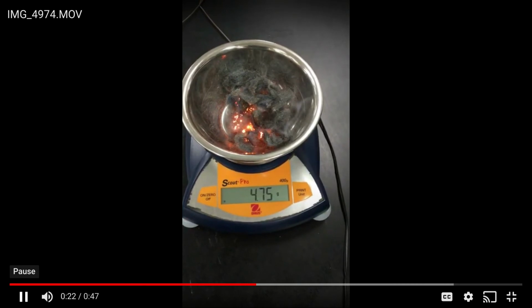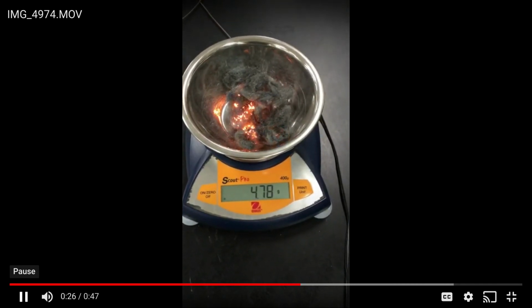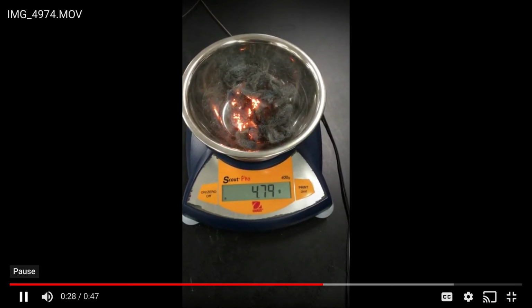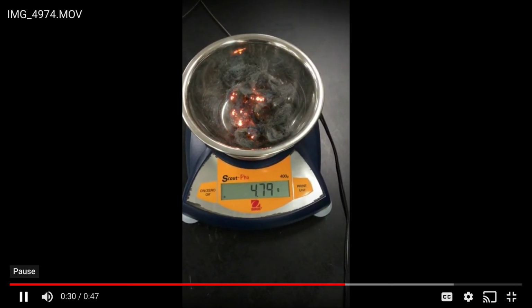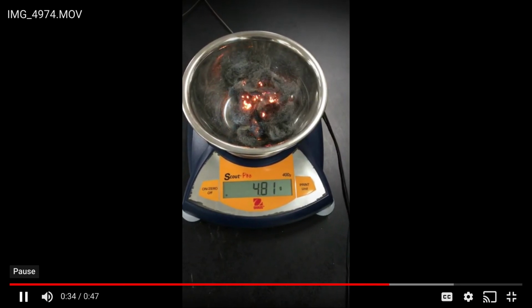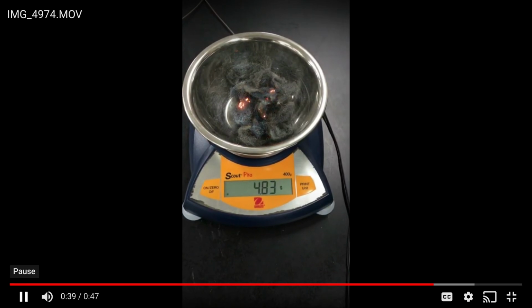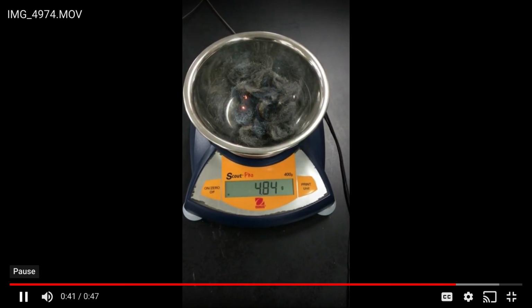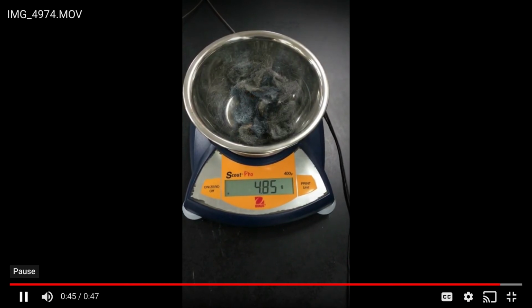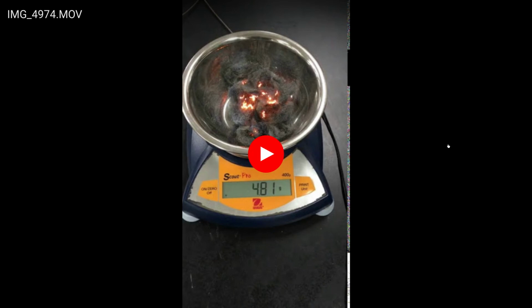All right, now we're starting to see the mass start to change. And you might be like, what? I don't get it. And that's not a fluke. That is what is happening when this change is going on. You can see how, as that steel wool is burning, it looks very different than what you probably would expect burning to be. Usually people think about fireplaces and how they start with a piece of wood and then the wood is gone. Now we actually have an increase in the mass.